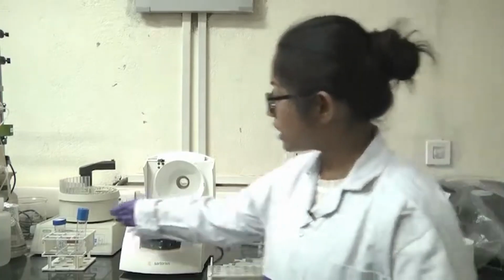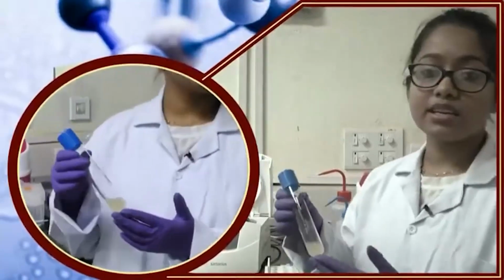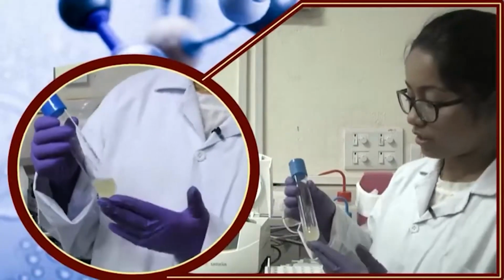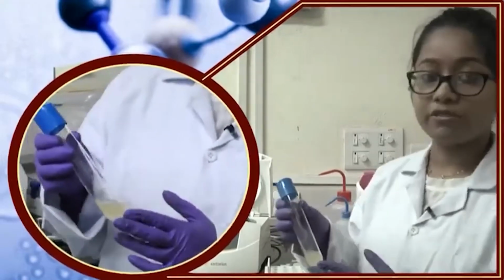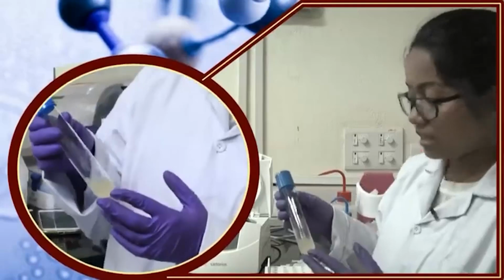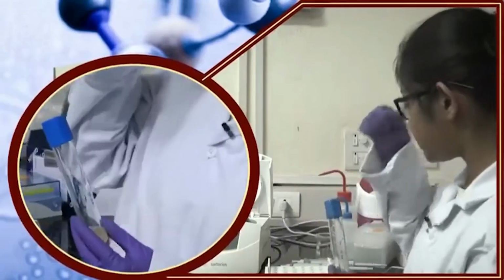Here we are using an LB medium where we have grown the bacterial culture. LB is an enriched medium, so you should use an enriched medium where the bacteria can happily grow, and the culture has taken around 15 hours. The OD is usually 3 to 5 at OD 600. So you need to have a large number of cells before you start extracting the plasmid from those bacteria.